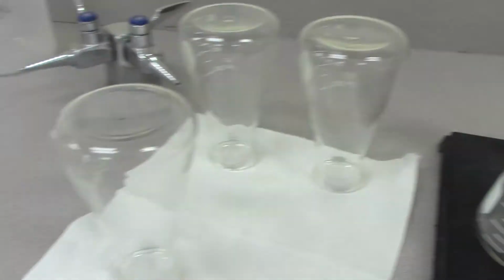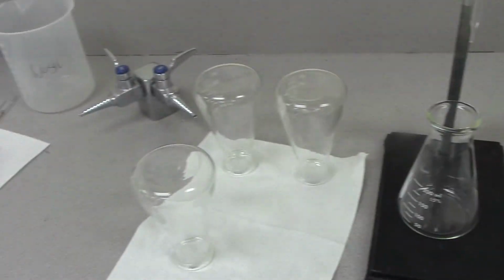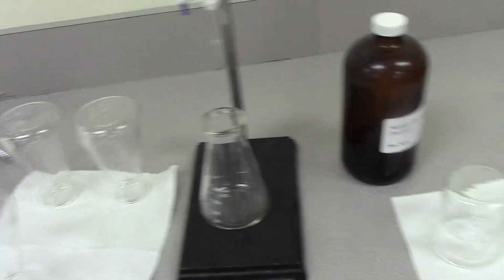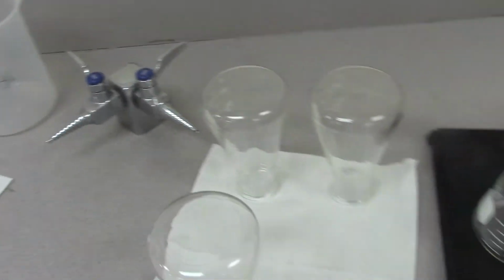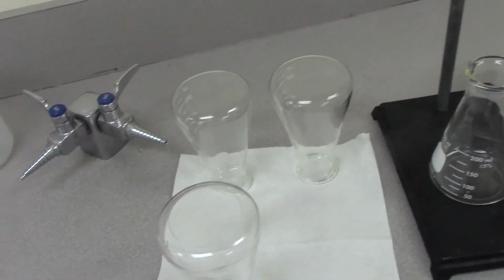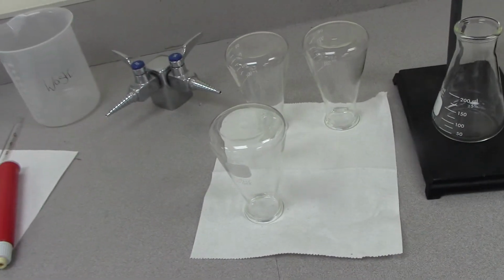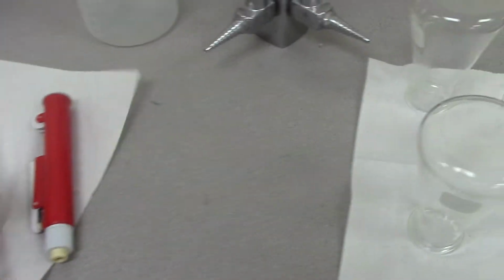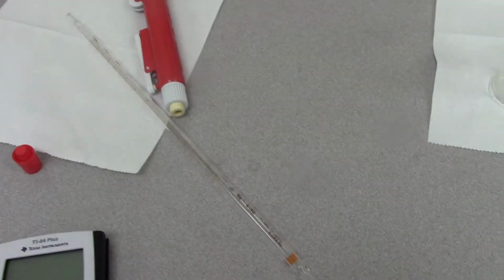And there's 4 Erlenmeyer flasks set up, because usually we do more than one sample, and then we get an average, and then if there's a sample that is above 0.1 to 0.2 milliliters away from the others, then we throw that one out. So you have to do more than one titration to get a good sample data. This is a pipette.